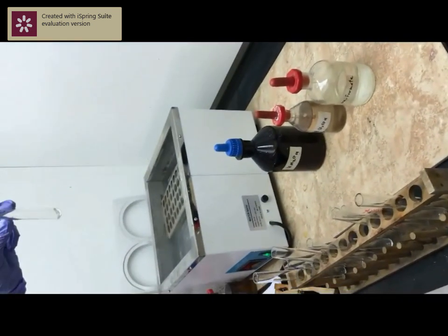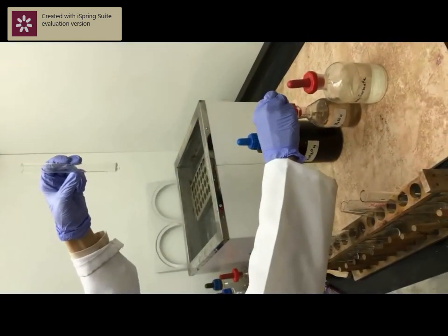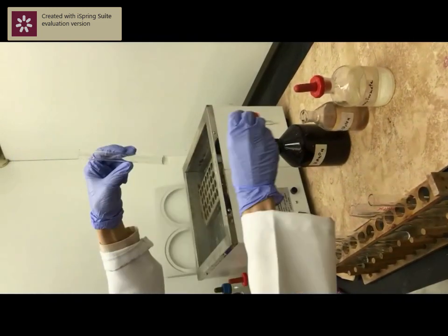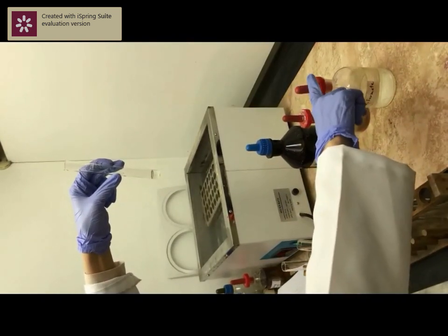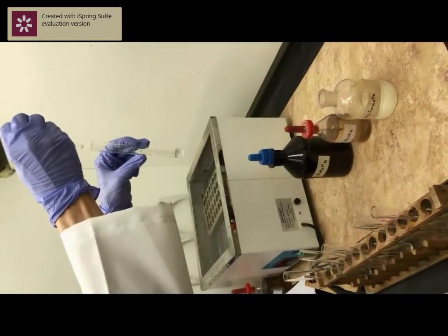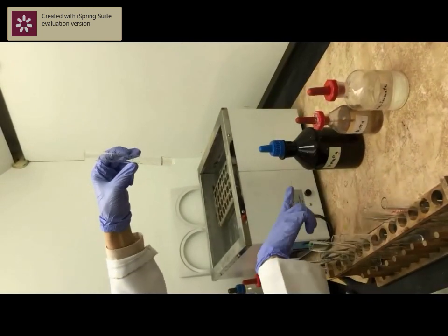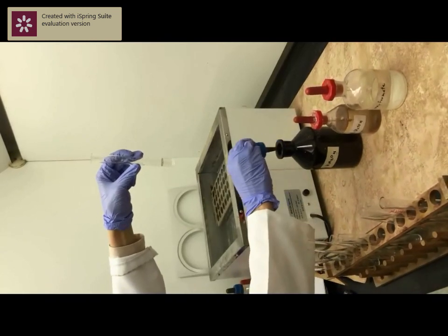Start with a clean test tube and add a few ml of diluted sulfuric acid, about 2 ml for example. Add formate solution, same volume, 2 ml. Now we will add permanganate solution drop by drop.